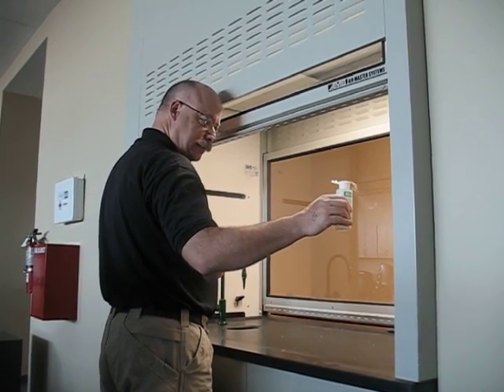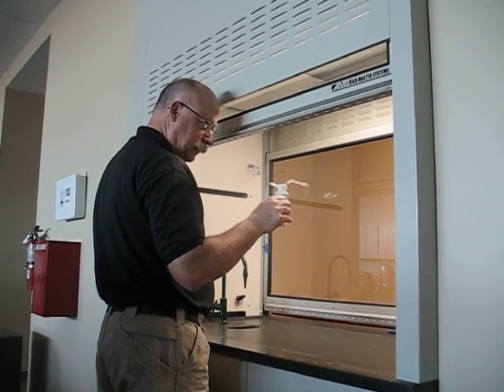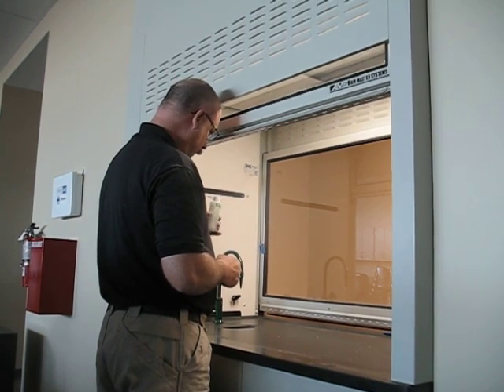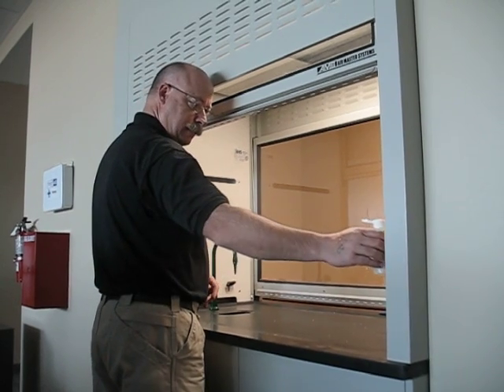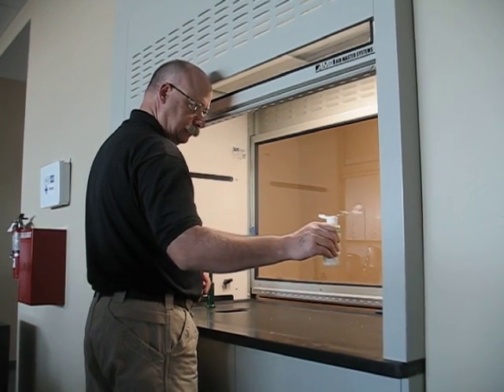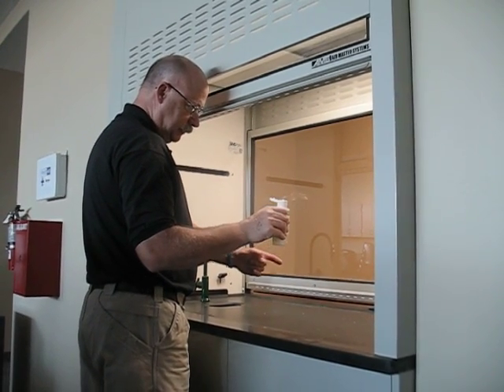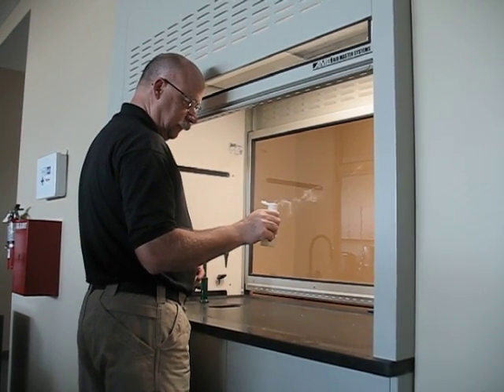I'm going to continue to do this over the entire face. I'm going to note static cells and reversals. I see a significant change just at this elevation as opposed to right directly underneath the sash door. I have a reversal cell right here. The fume is going in. It hits the back end of the laboratory fume hood, and the smoke rides outside of the hood base.